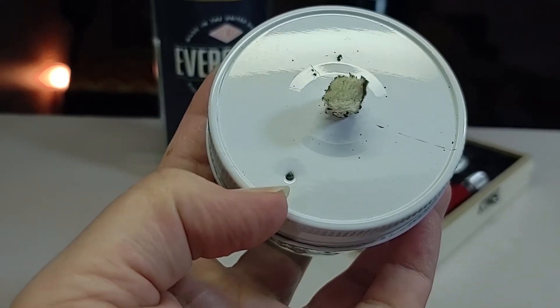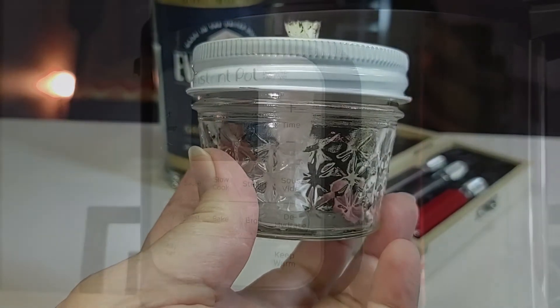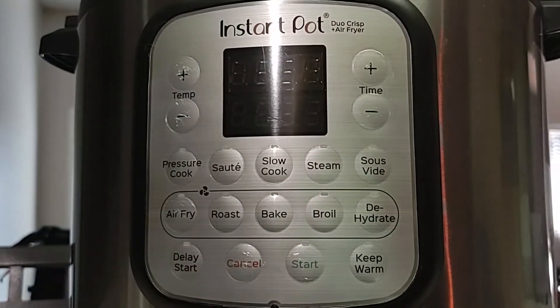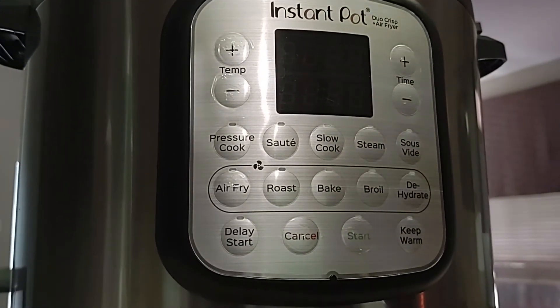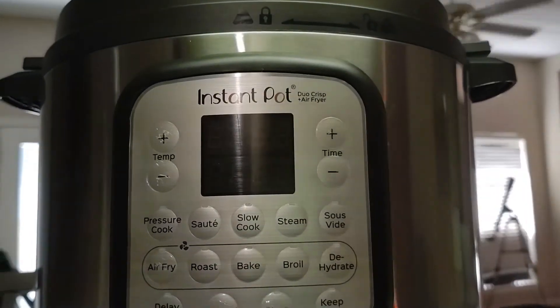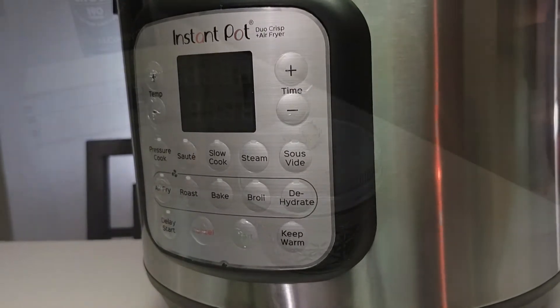More specifically, home mycology made easy. In this video, we're going to share our favorite sanitization techniques that we believe have given us instant results. We believe genetics, nutrition, technique, environment, and sanitization are the key factors of being successful. That being said, we're going to focus on sanitization and sterilization in this video.